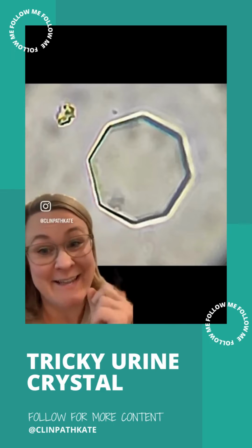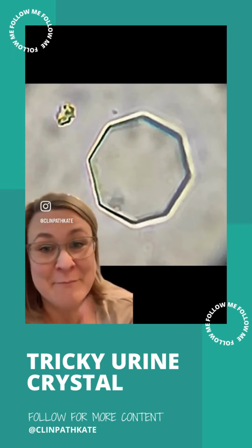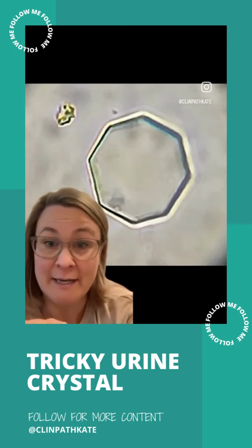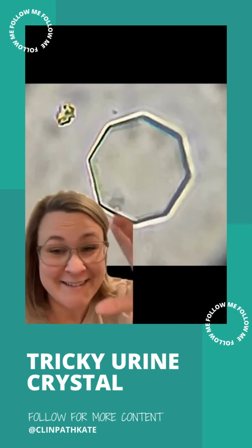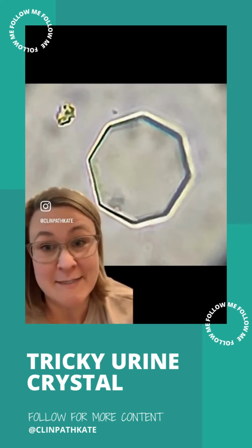So this is a struvite. Okay, you might be thinking, like, where are you getting that from? Count the sides. How many sides does this crystal have? It has 8. This is a struvite that is just really fat, and it's not crunched down to that kind of coffin shape. Let's look at a cystine and compare.